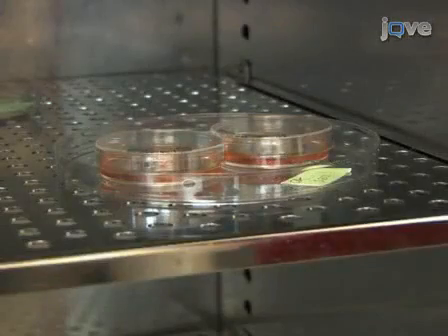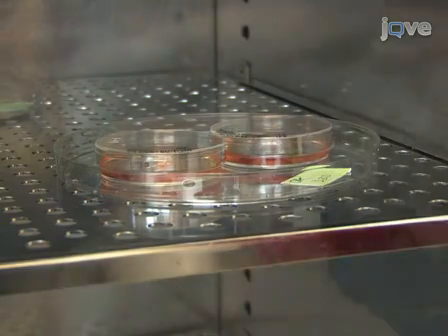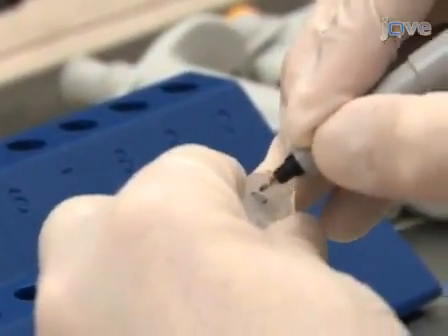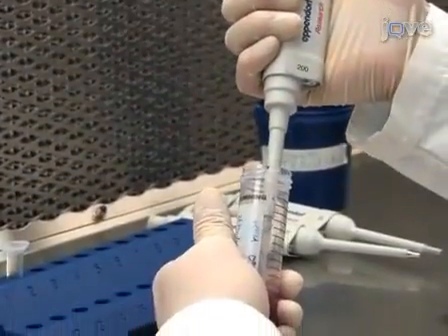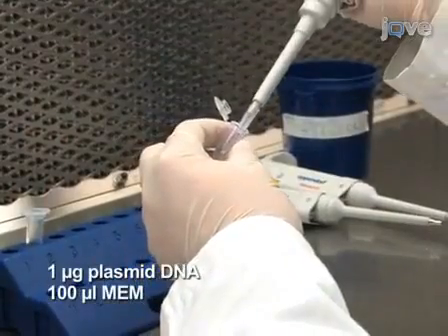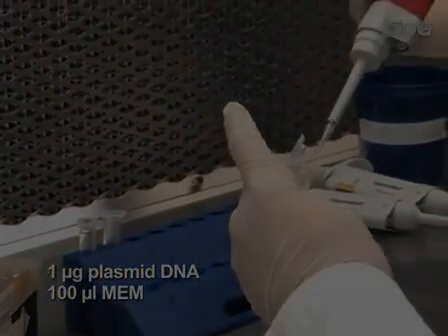For most experiments, we use dishes of rat hippocampal neurons that have been cultured at a cell density of 250,000 cells per 6 cm dish. For each transfection, label two 1.5 milliliter tubes, one for the plasmid DNA and the other for the transfection reagent. In a laminar flow hood, combine 1 microgram of plasmid DNA with 100 microliters of MEM in a single tube at room temperature. Be sure to use MEM that does not contain any supplements.